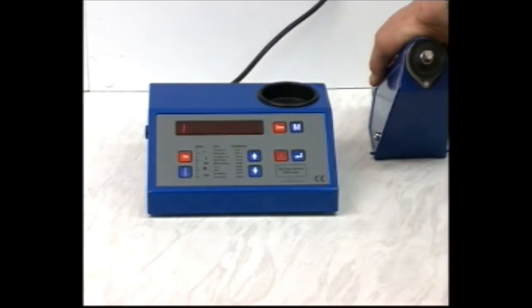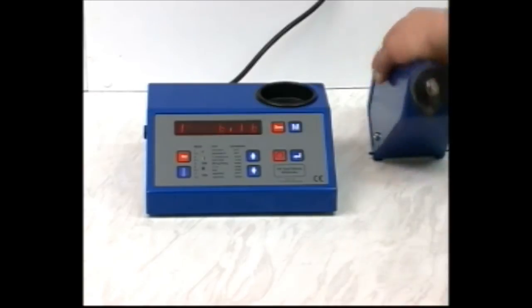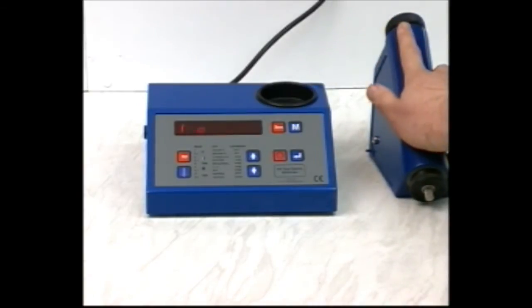When the movement is complete, you will receive another tilt prompt. Tilt the viscometer again and wait for the ball to complete its journey back.